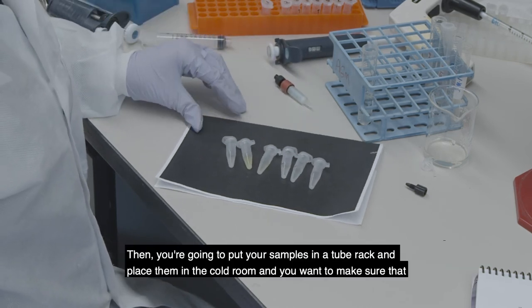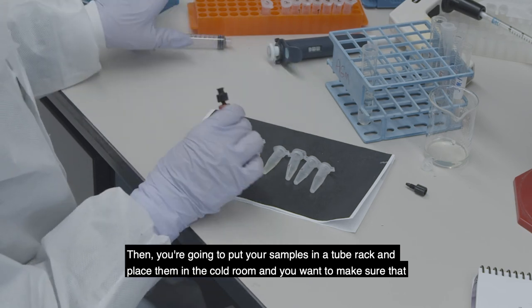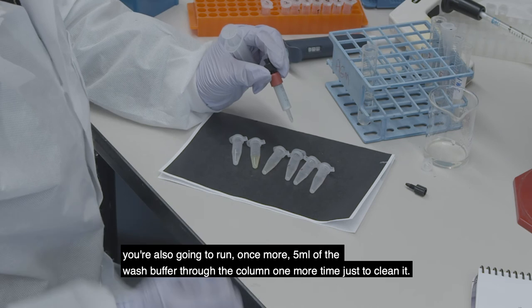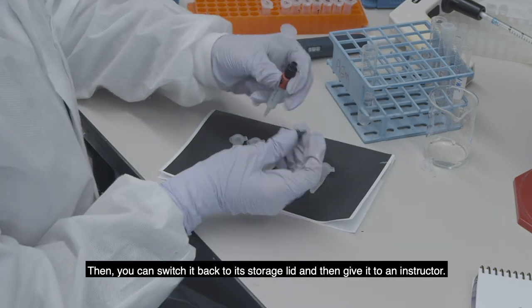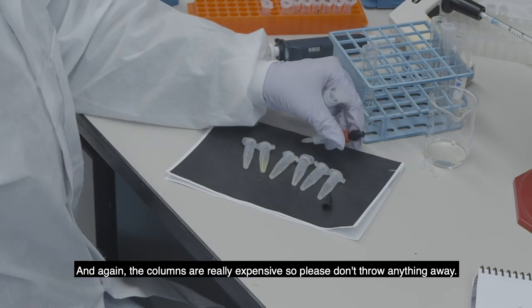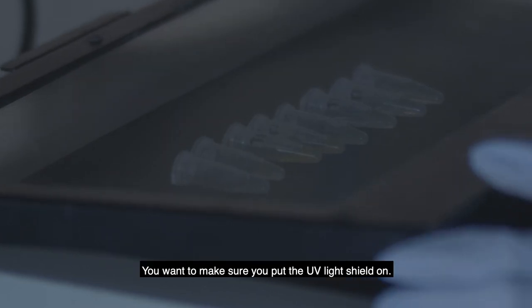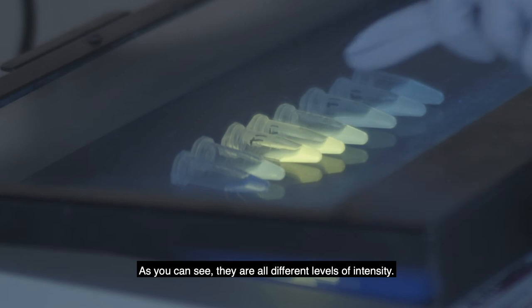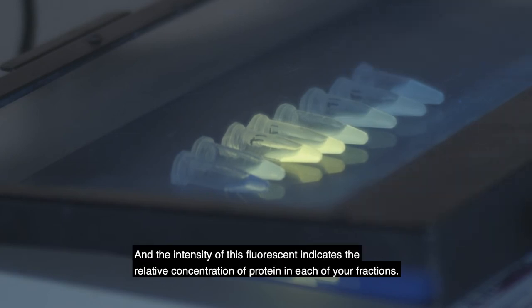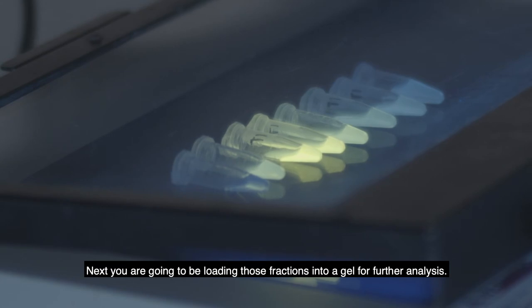Place your samples in a tube rack and put them in the cold room. Also run one more 5 milliliters of wash buffer through the column to clean it, then switch it back to its storage lid and give it to an instructor — again, the columns are very expensive so please don't throw anything away. Once you're done, arrange all of your fractions in order on the UV light box, put the UV light shield on, and turn it on to visualize your fractions. The intensity of the fluorescence indicates the relative concentration of protein in each fraction. Next you'll be loading those fractions into a gel for further analysis.